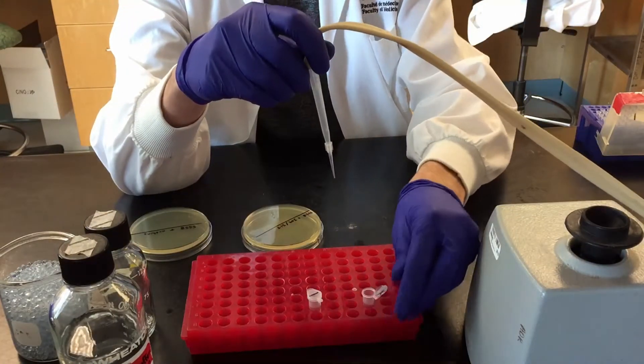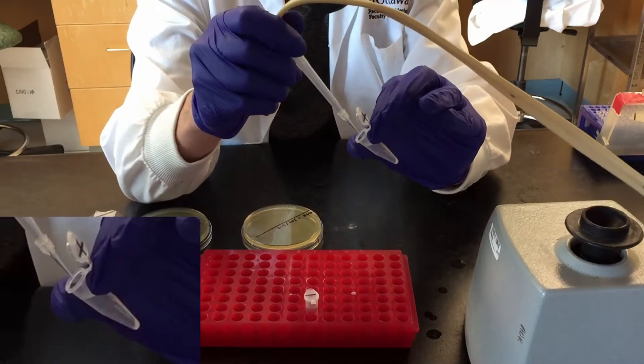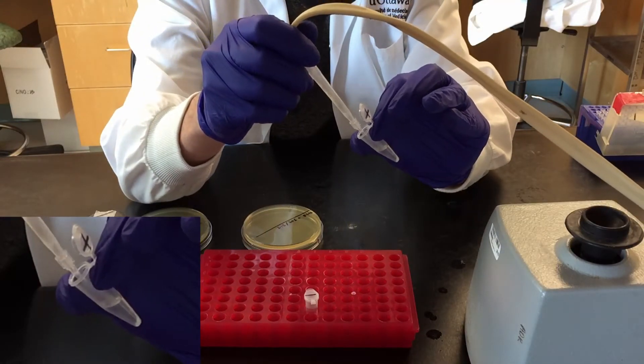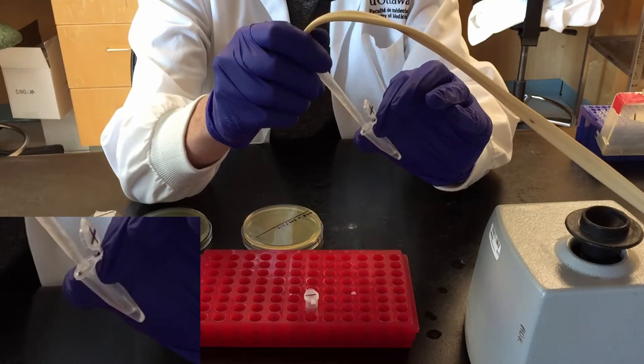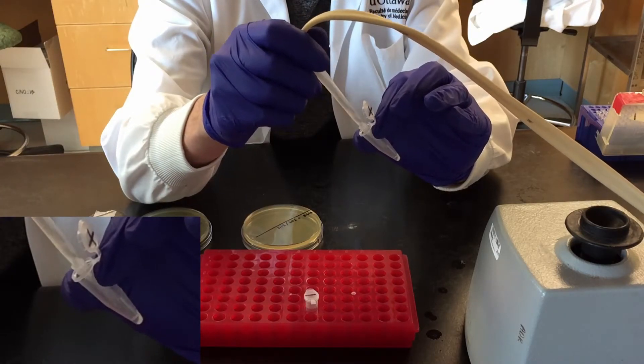Be very careful not to suck up the gloopy mass near the cell pellet because the cells will likely come with it.